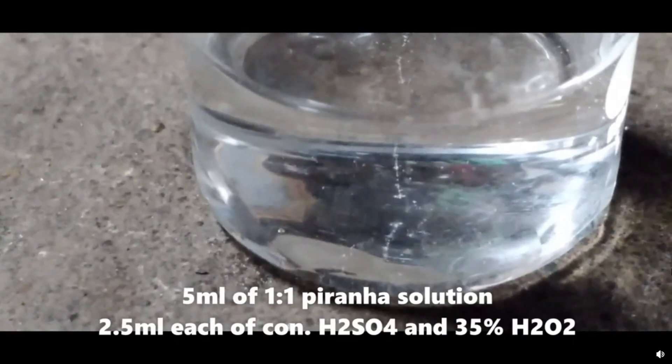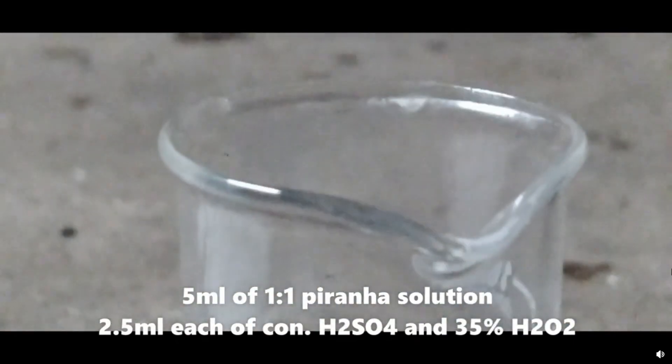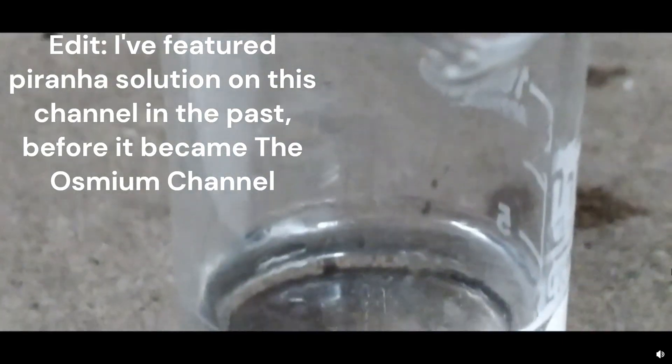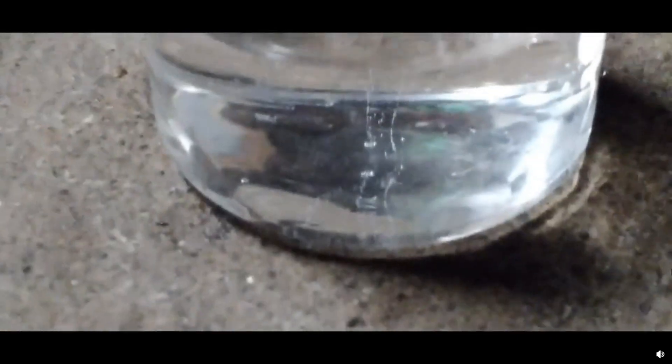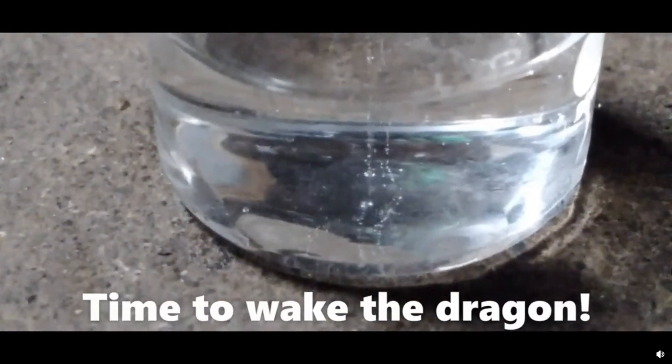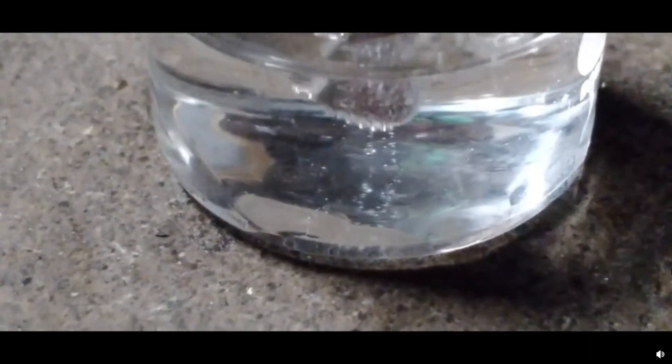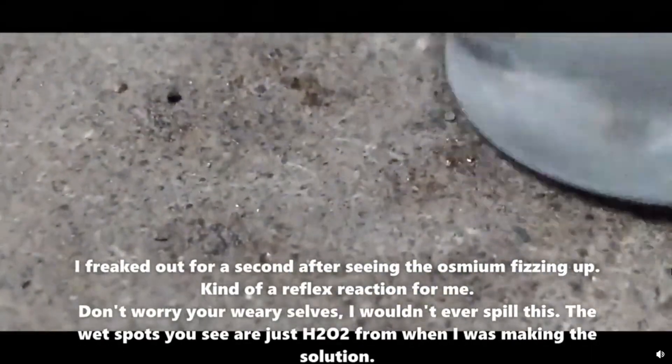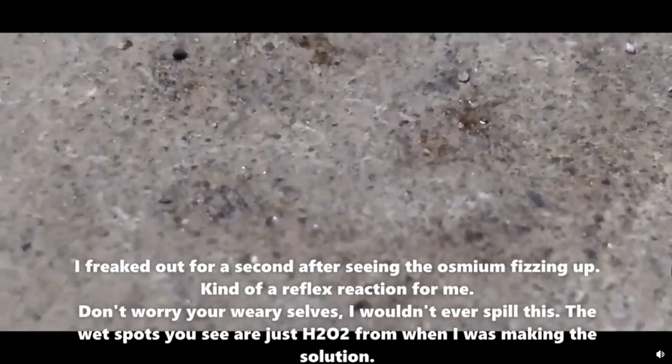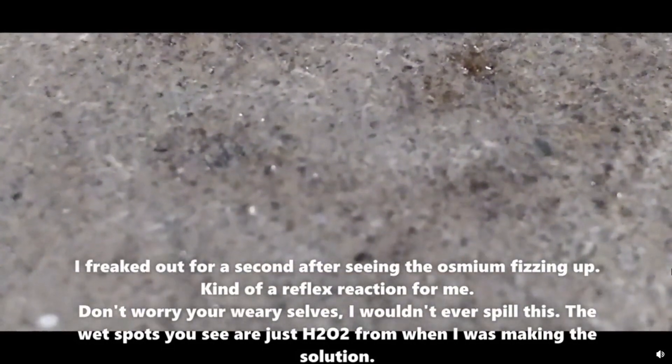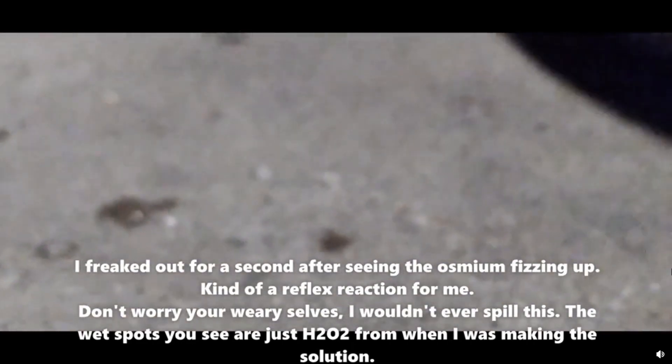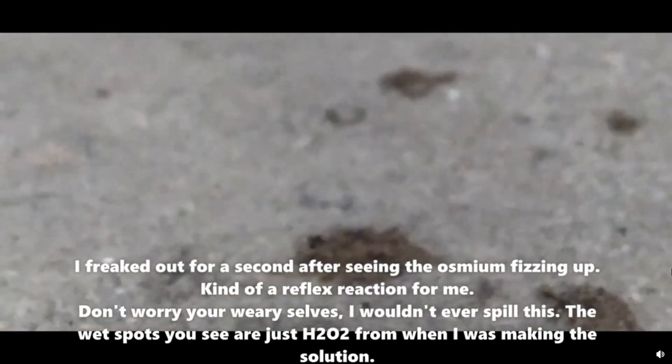But we'll just have to see what happens. I'm just going to pick up the Osmium properly first. Okay, I've got it. I have got it. I'm putting it in. Let's get it in. That gave me a scare for a second.